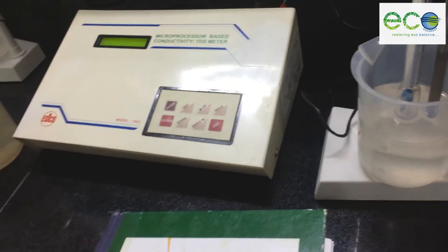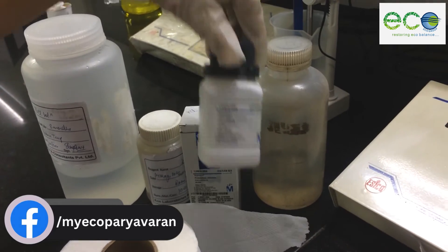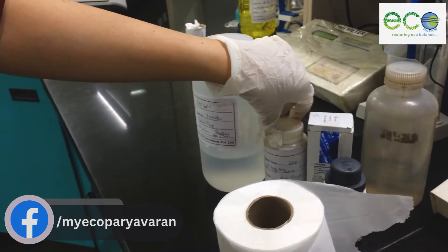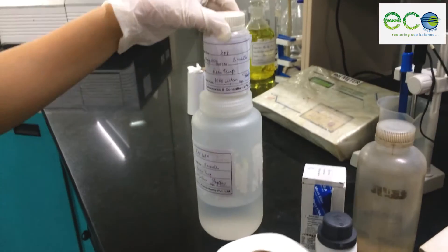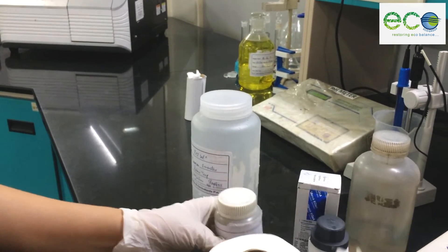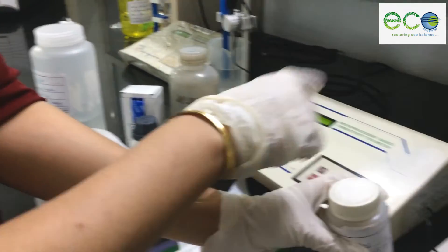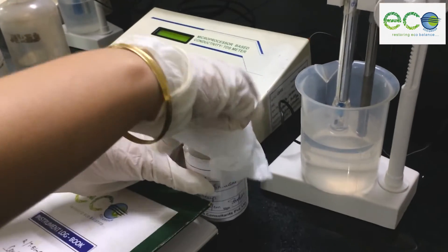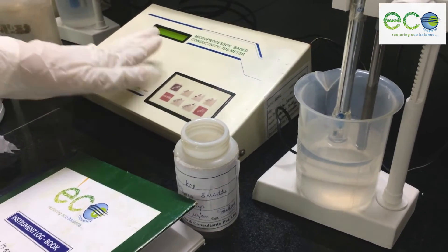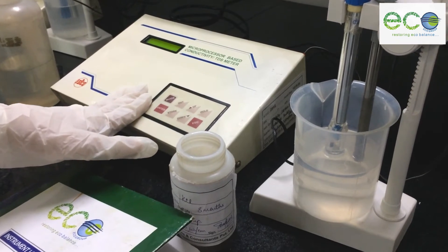We need to calibrate this conductivity meter using a KCL solution. We need to prepare a 1000 microsiemen per centimeter conductivity solution for calibration. This KCL buffer solution is used to calibrate the conductivity meter, and we will set it at 1000 microsiemen per centimeter.